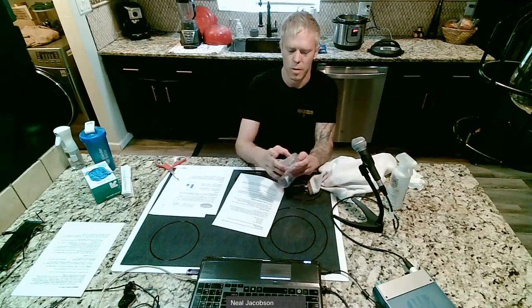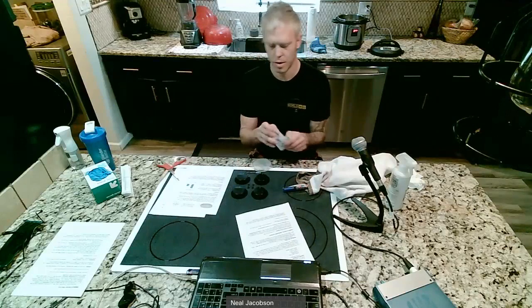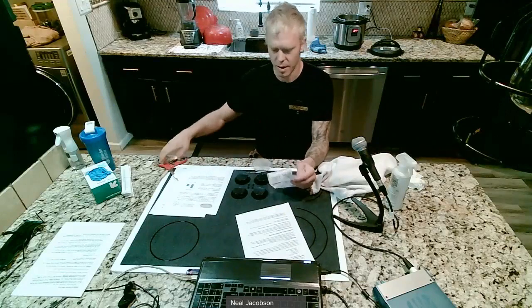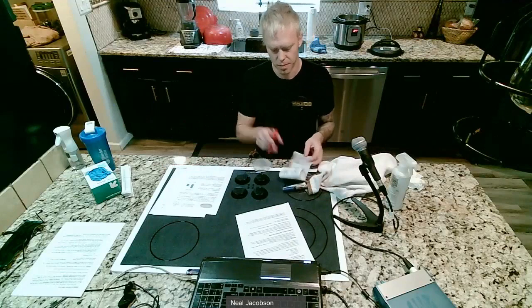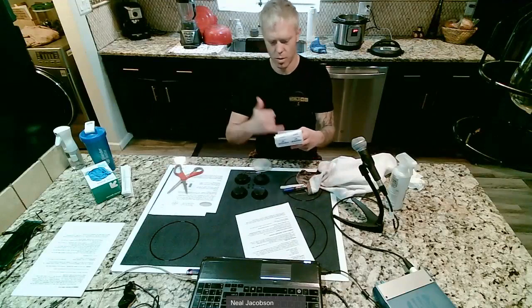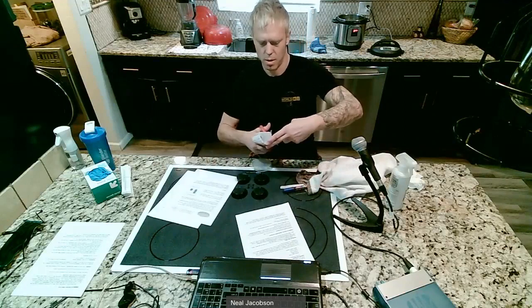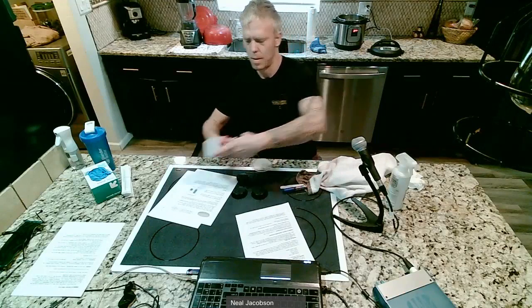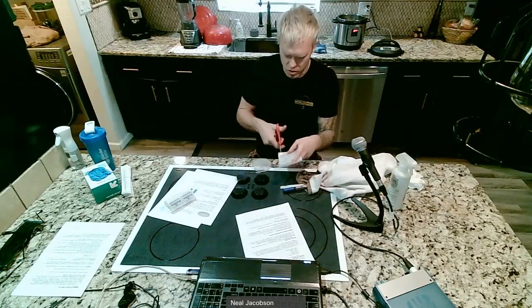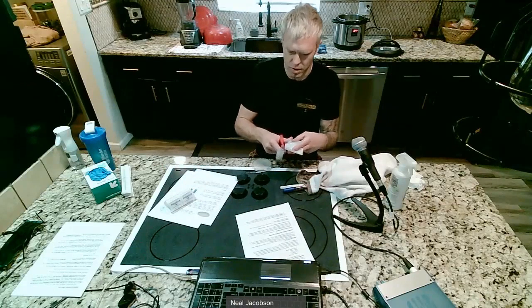Boom. Put the lid back on. Yeah. And now we get to take our parafilm and make a little band to go around the outside of it to seal it in. With the parafilm, what you can do is go about 3 lengths, cut those off, and then cut a little strip. Make it about 1 inch, maybe 3/4 of an inch.